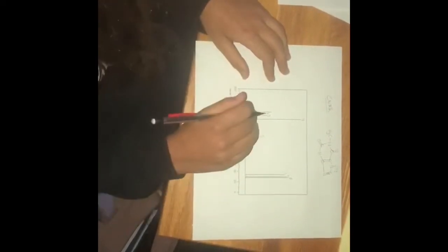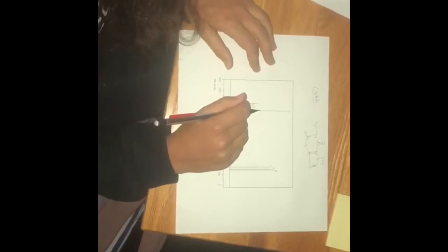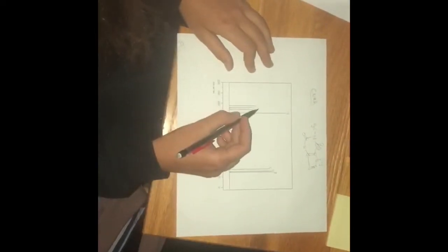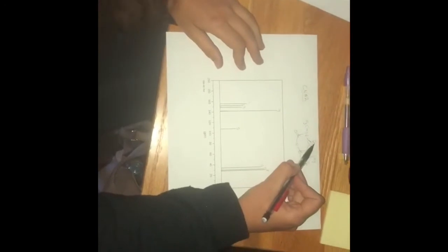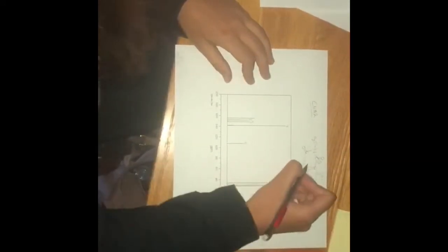And so I'm going to start with the first one, which is going to be here, which is the farthest downfield, so that means it's the most electronegative, and that would make sense since it's bonded to this O right here. Number 2 is right here, also bonded to a nitrogen and has a double bond.